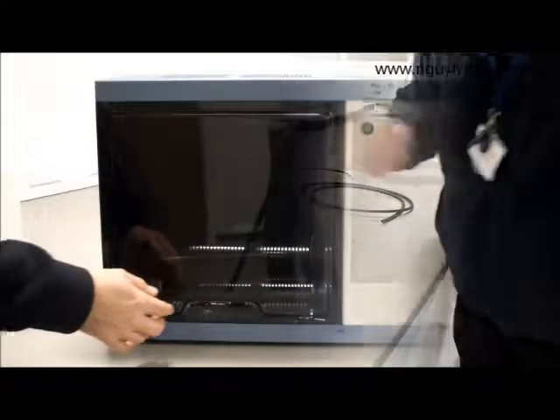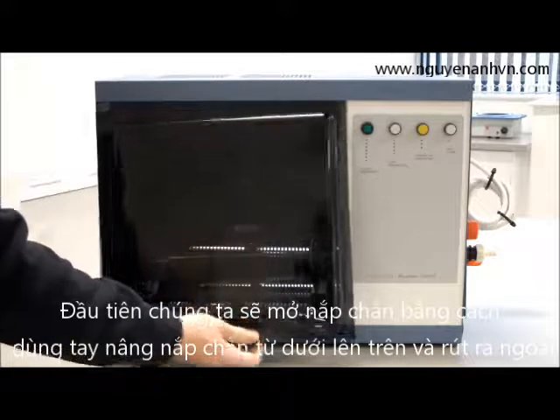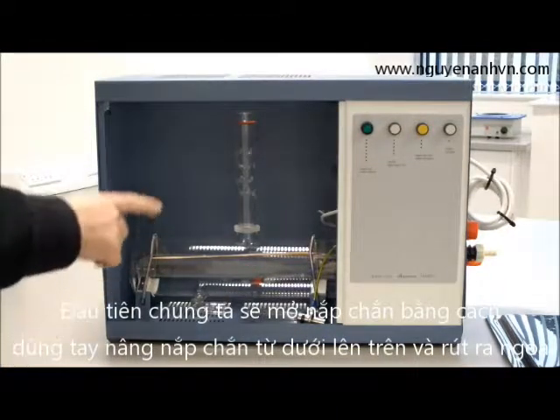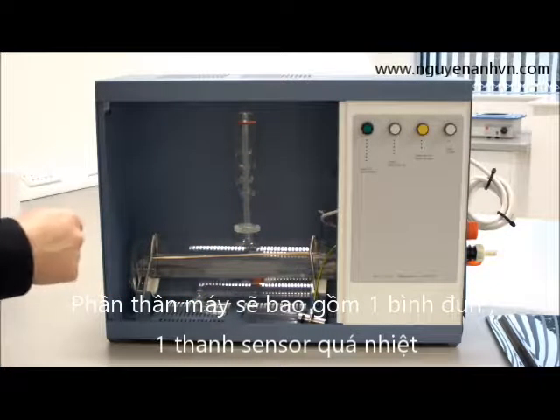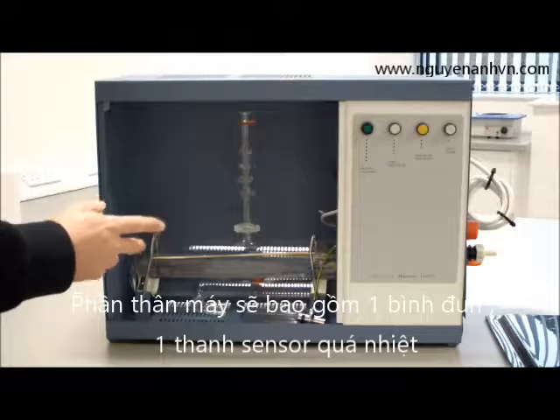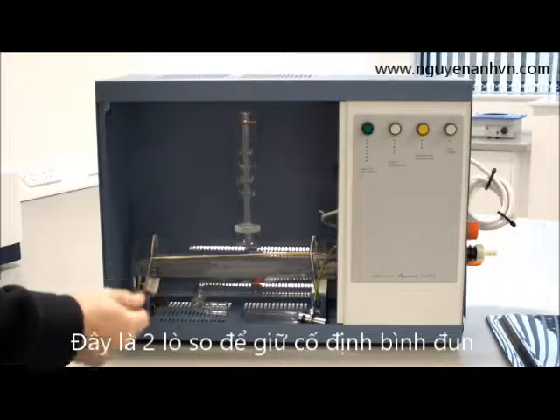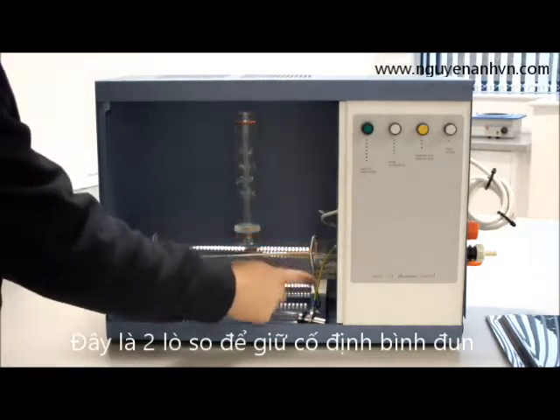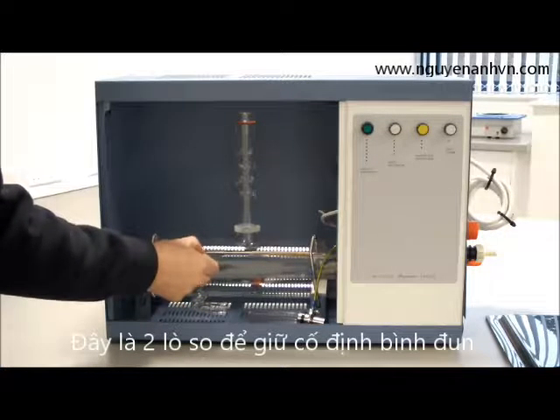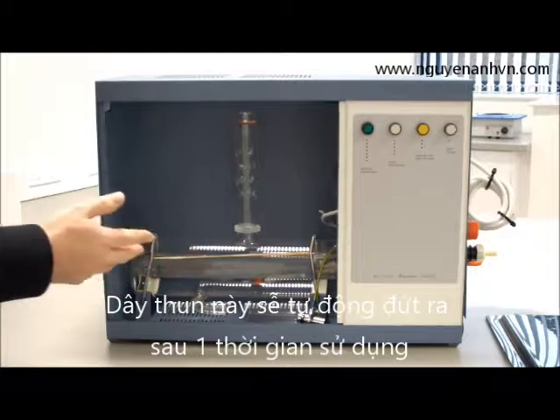To remove the fascia of the unit, we lift up and pull out and the fascia can be removed. Inside, when you receive your unit, you will see lots of packaging that needs to be taken out very carefully so as not to break any of the glass or the thermostat. Once the packaging has been removed, you will see retaining springs around the boiler and a tie. This tie needs to be snipped when setting it up, so the first thing you want to do is snip that.